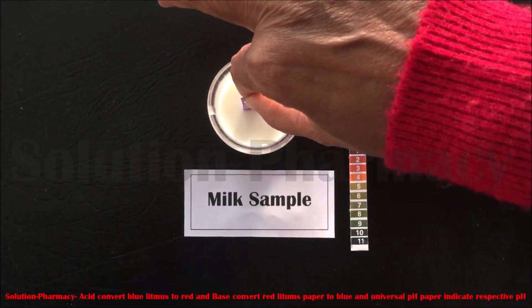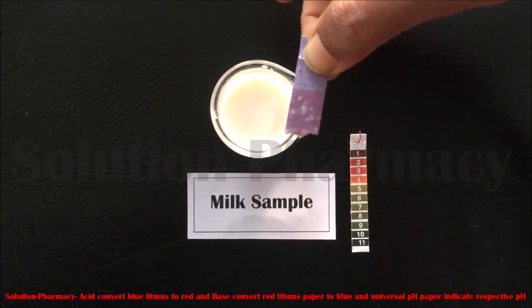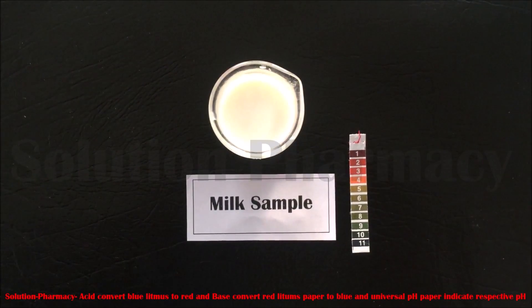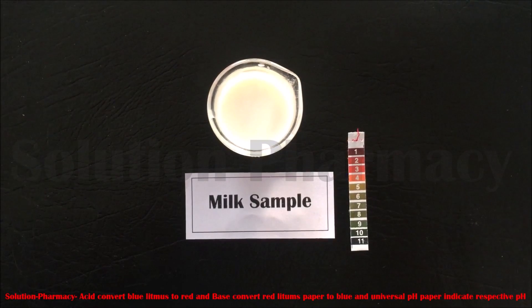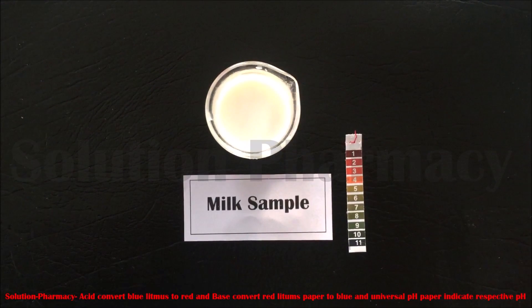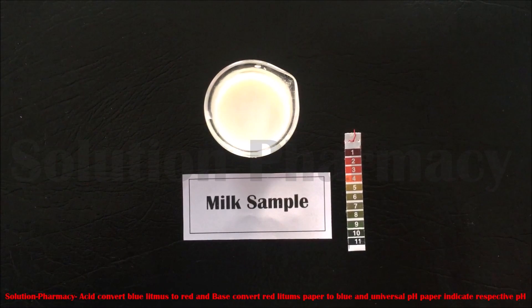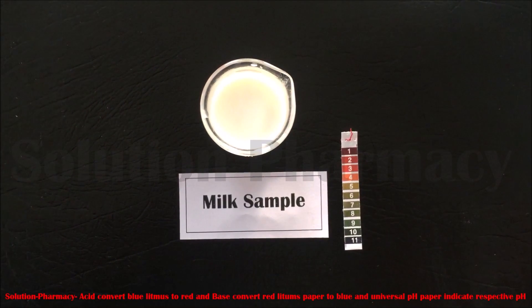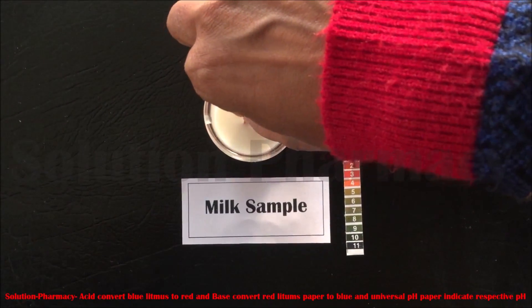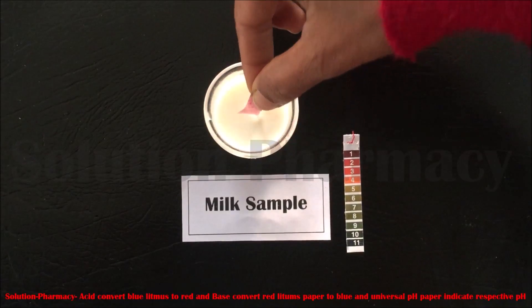Next, we have taken another sample — milk. Dip the blue litmus paper into it. You can see the blue litmus paper slightly changes to red, which means milk is slightly acidic in nature. You can also perform this experiment another way: with the help of a dropper, take the solution from the beaker and put 2 to 3 drops of the sample on the pH paper, then observe the color change.